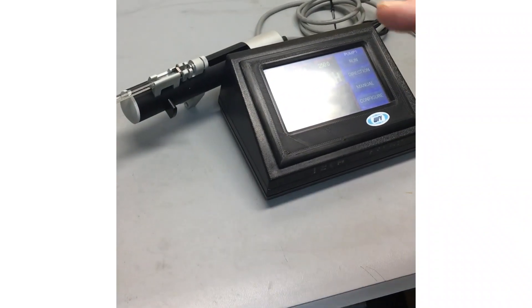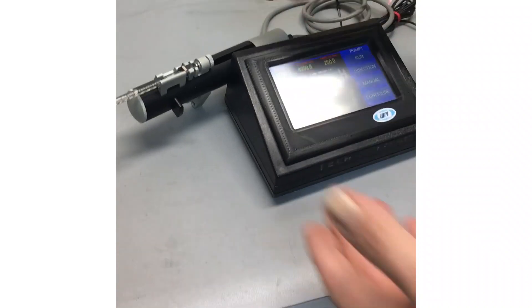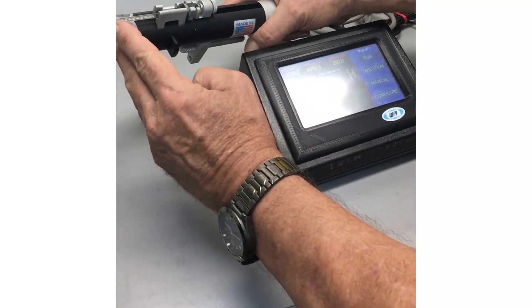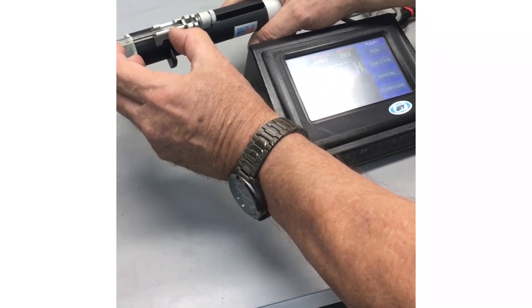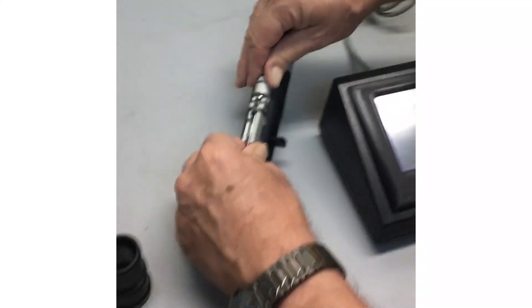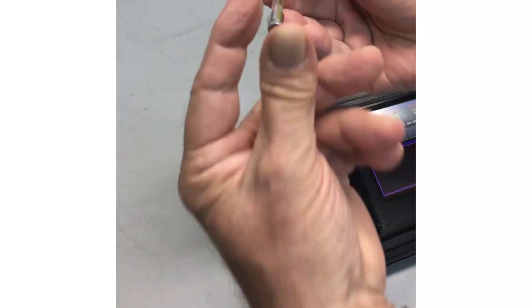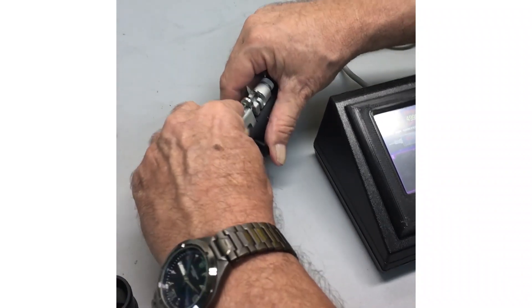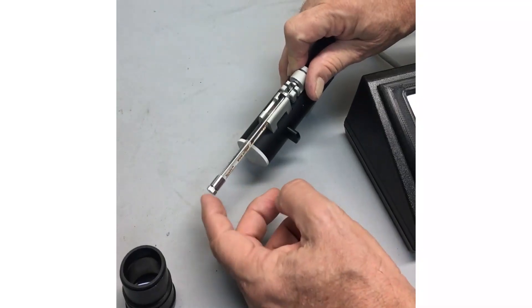That's just to set up the pump with the syringe through the controller. That does not pre-fill the syringe with fluid — you have to get all the air out of the syringe. Otherwise, if I stuck a needle on here, it's full of air. I stick it in a solution and try to withdraw — I might withdraw fluid up to two microliters and the rest is going to be depressurized air. So normally at this point you would take the syringe off and use the instructions in the manual to front fill — basically take it apart, front fill fluid into it, push it all the way back down to the zero mark, and remount the syringe. Now the syringe is partially primed with water, and the needle's already on there.